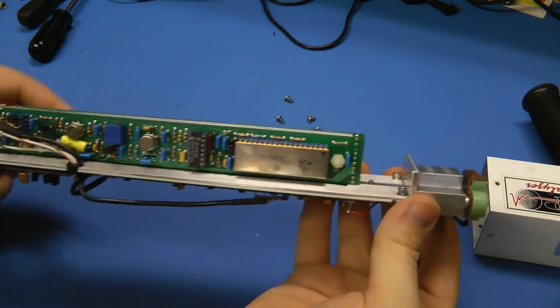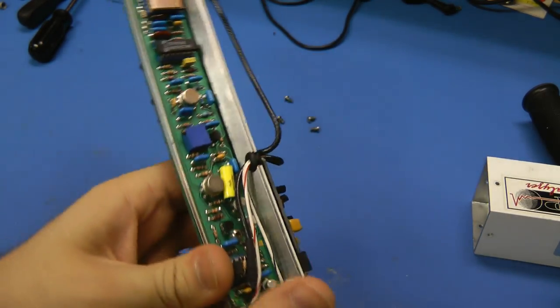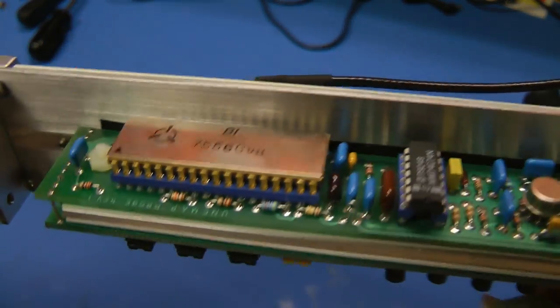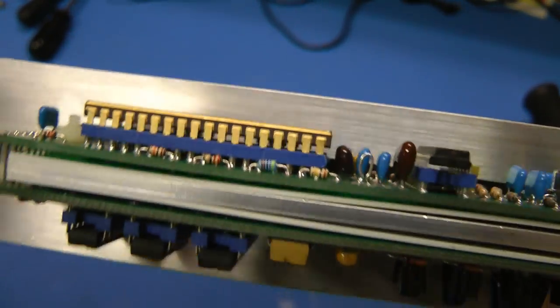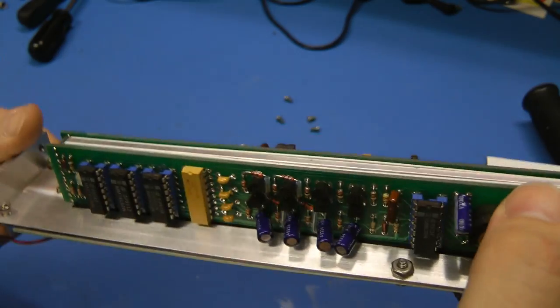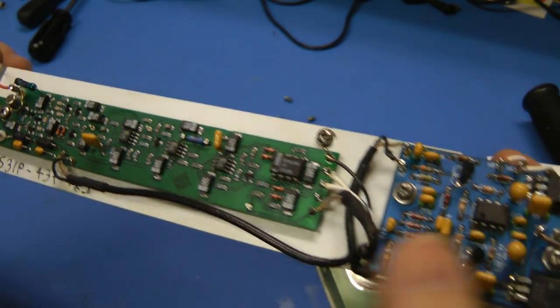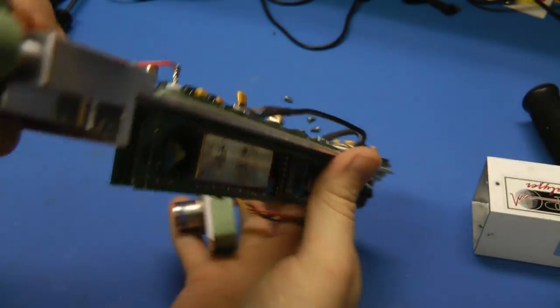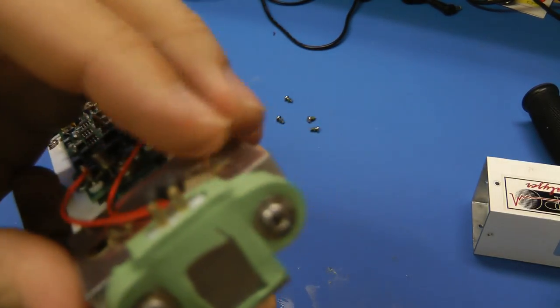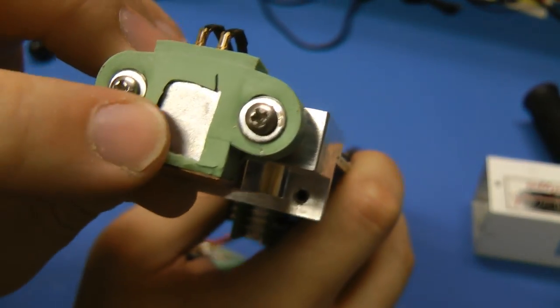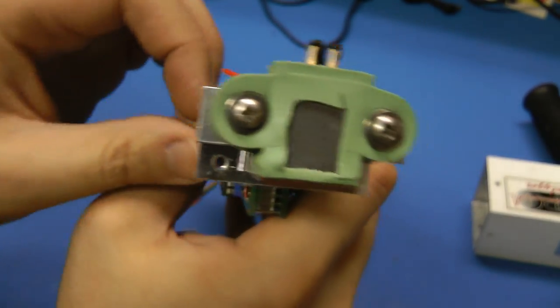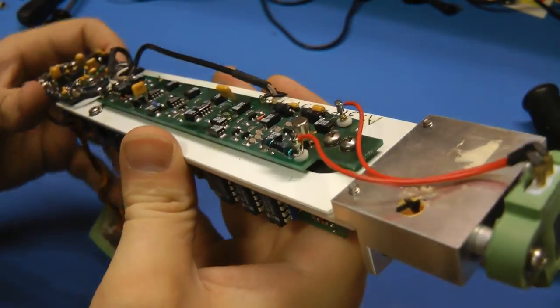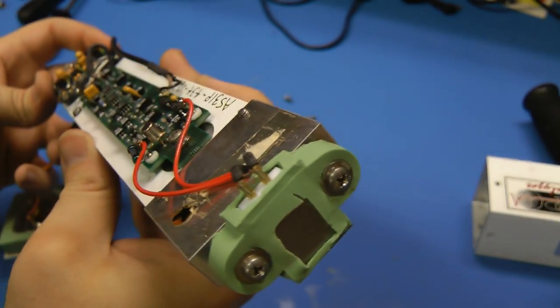And now the internal circuitry seems to pull out. There we go. Interesting. So a whole bunch of boards. Oh wow, look at this metal can, metal lid ceramic IC. Look at that. So there's one, two, three, four boards in this. Here's the sensor. This must be some sort of a vacuum package. They've cut the front off of it for some reason, I guess to let the X-rays through better. Yeah, let's go take a look through these boards.